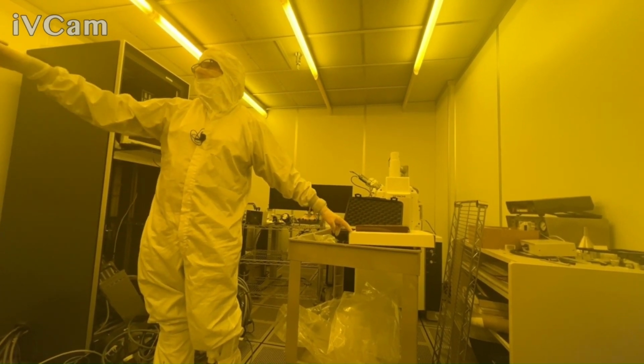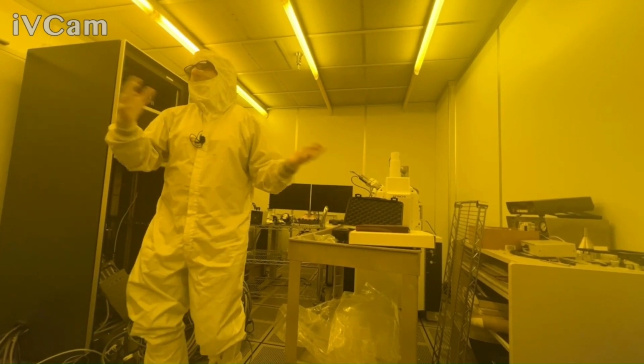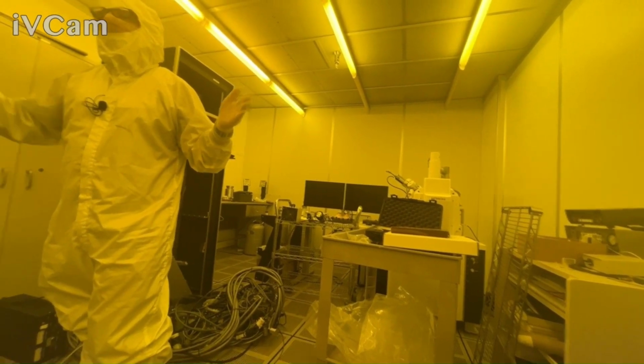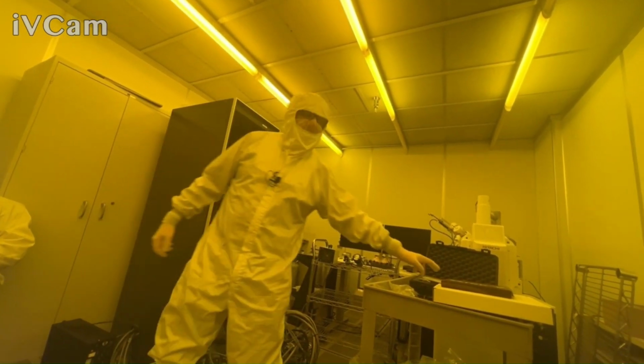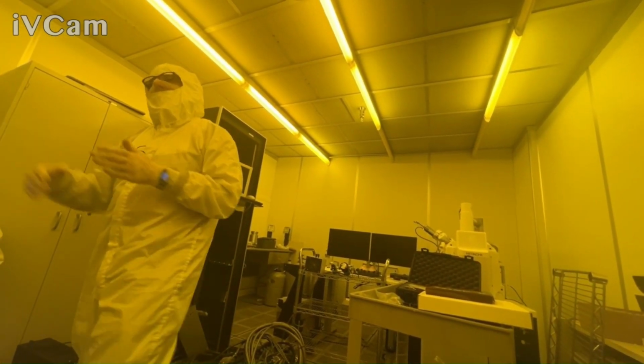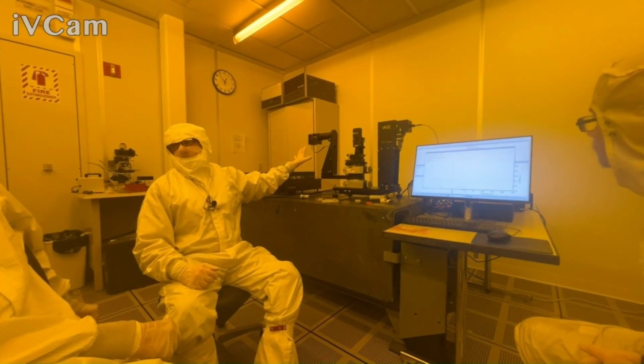Otherwise, I would just leave that one on, because this one will not transmit all the way in the deep UV. That fiber's been a nice fiber because it covers a really wide range by itself. But the reason you have a secondary fiber in here is for that very long end. Now we can cover with one arm. This is the widest range we can do with one arm.